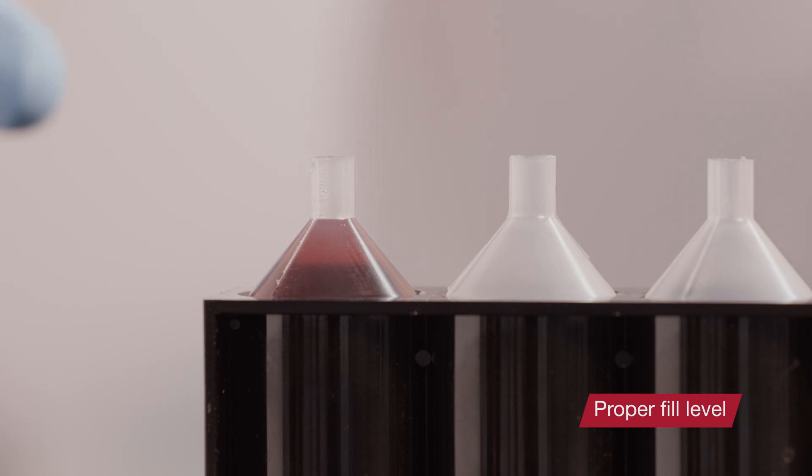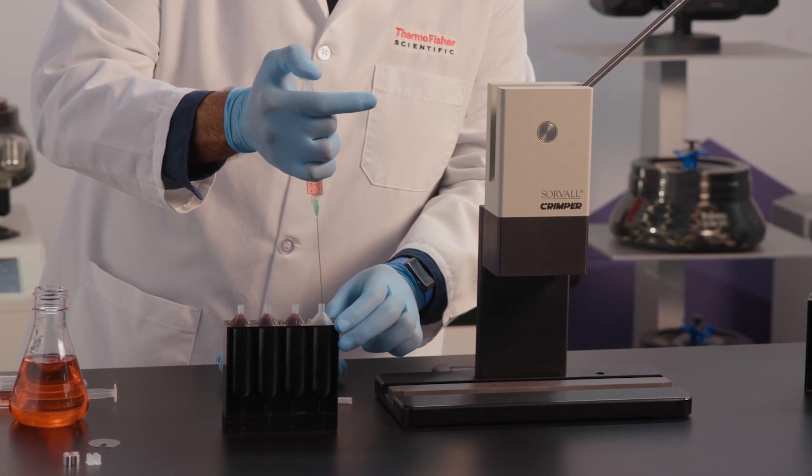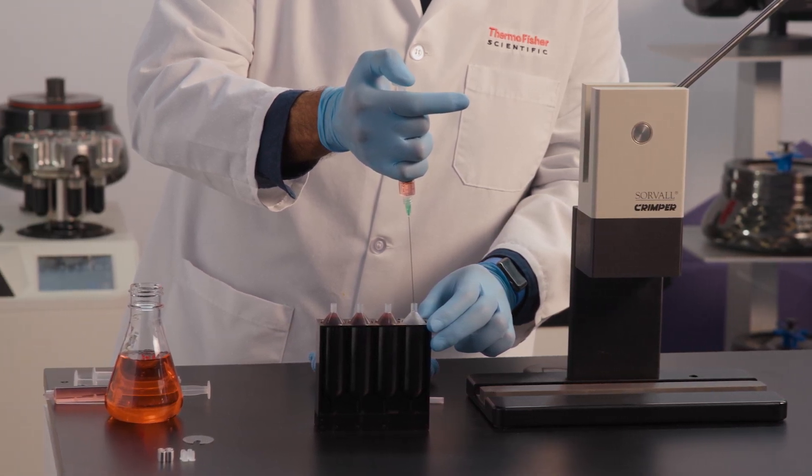Make sure to fill each tube to the base of the tube neck. Ultracrimp and clear crimp tubes don't work properly when only partially filled.